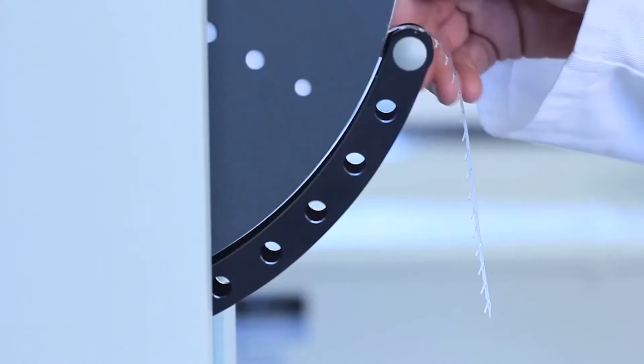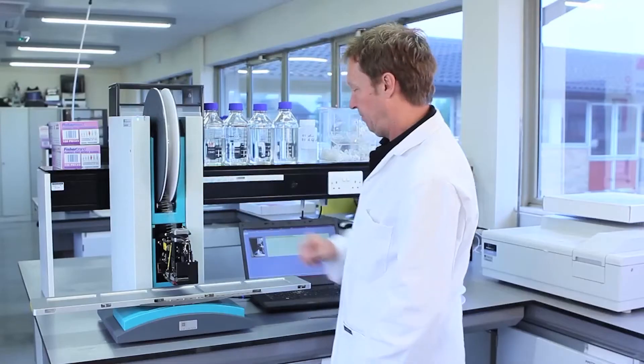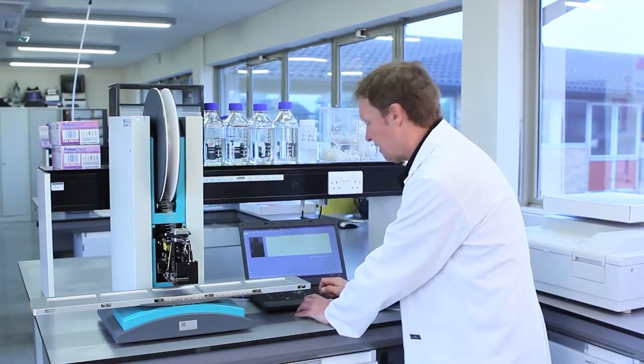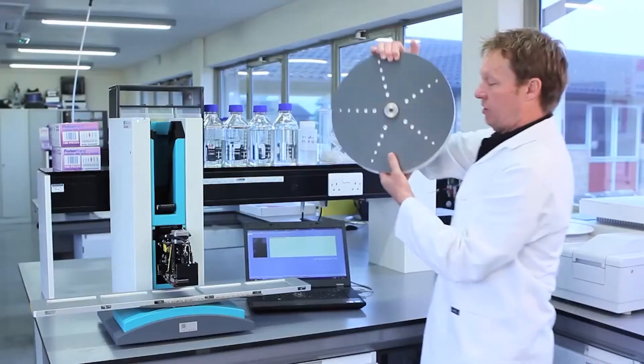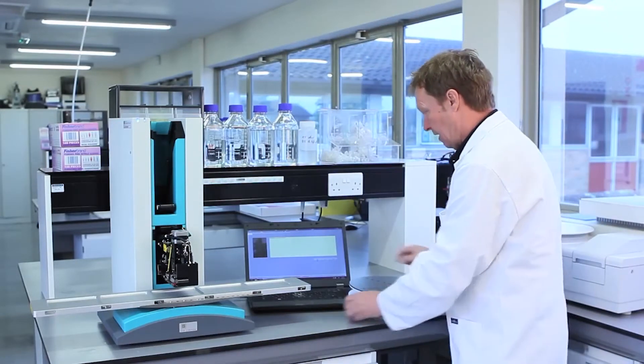Next, click the dancer arm and click next, and now we remove the spool. Put it onto the side and click next.